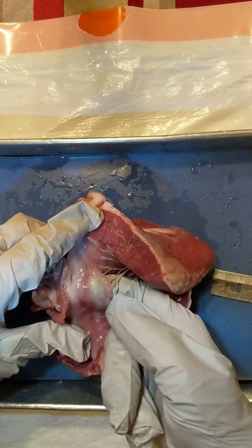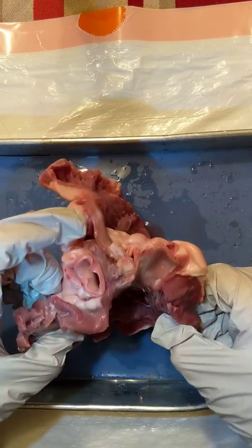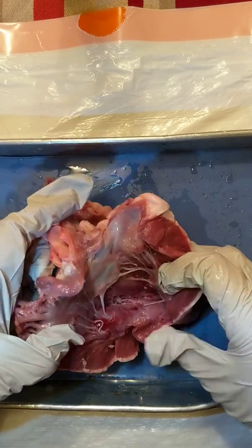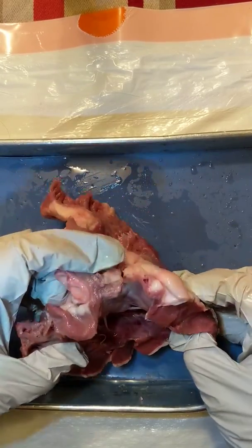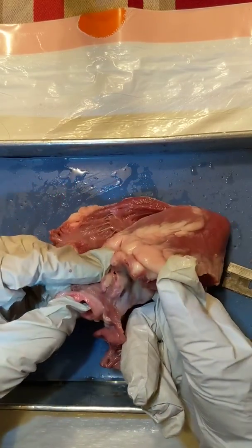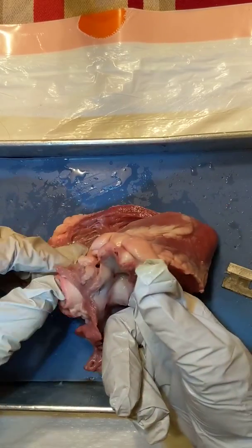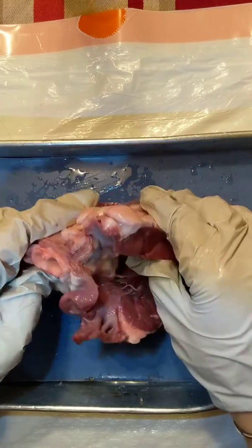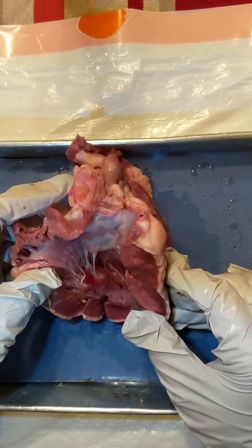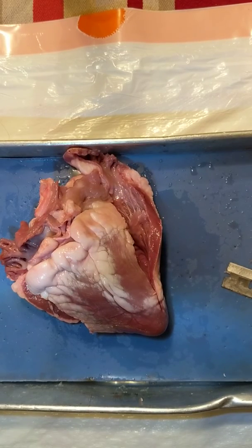That is the left side of the heart. Remember, it does eventually go out the aorta behind here — there is another valve up there too, but it's not as cool as the mitral valve. And that is the end of our heart dissection. You may play with the heart if you would like.